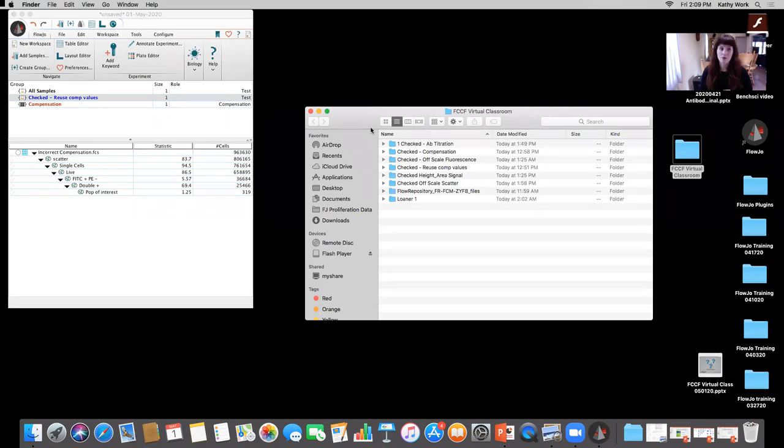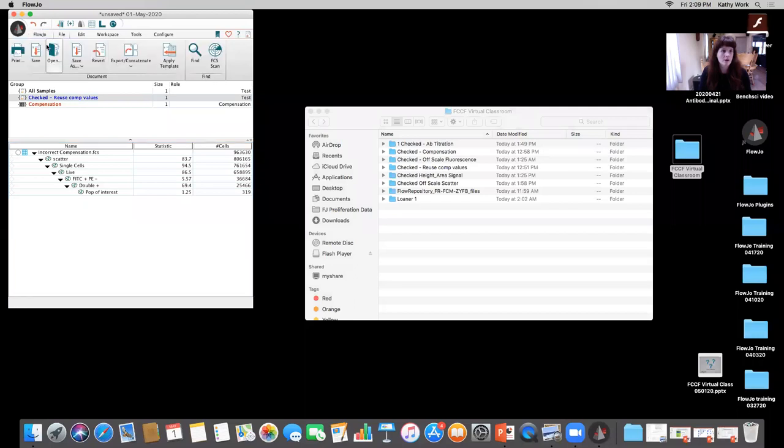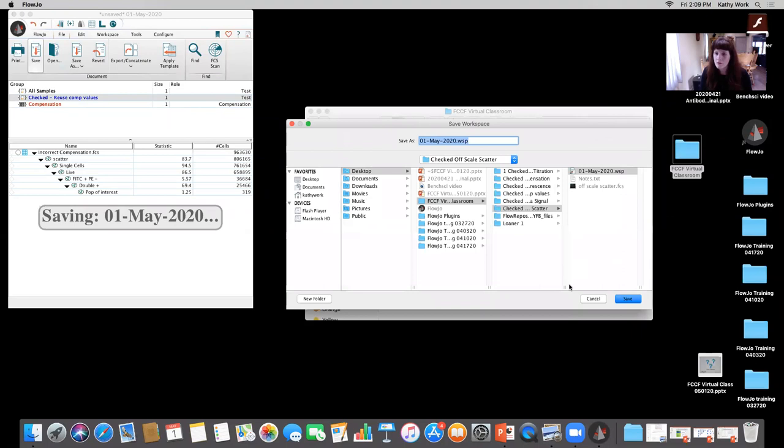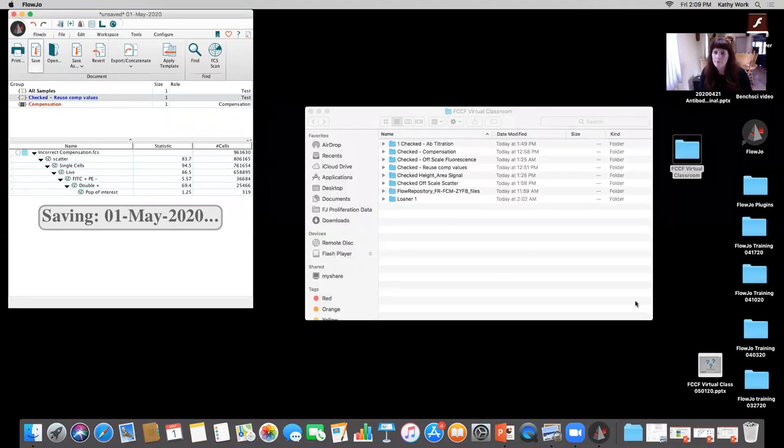Mm-hmm. Good. Okay. Thank you. No problem. Okay, so I'll save that one. Going to be under reuse comp values, okay.